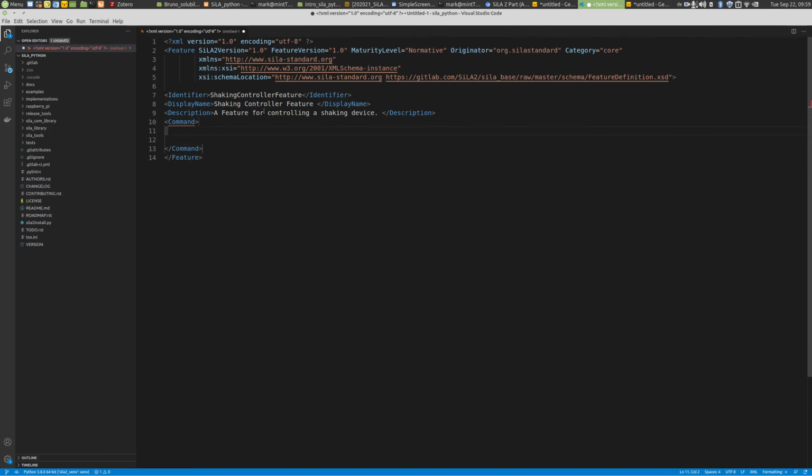So the command has again an identifier, and then you also have a display name, so you can use something nicer than just the camel case. And then you should also have a description here: to set the shaking speed of the thermo shaker.